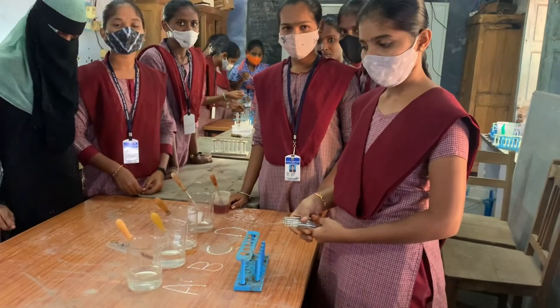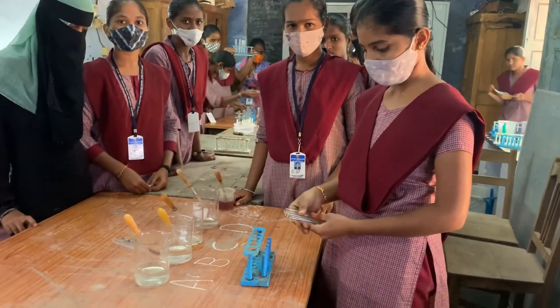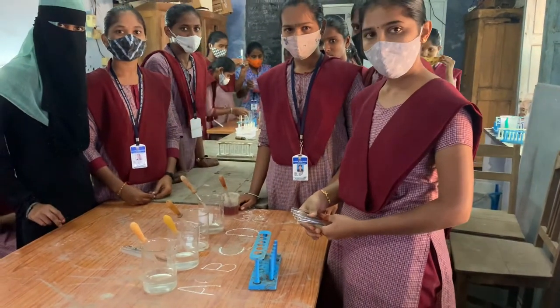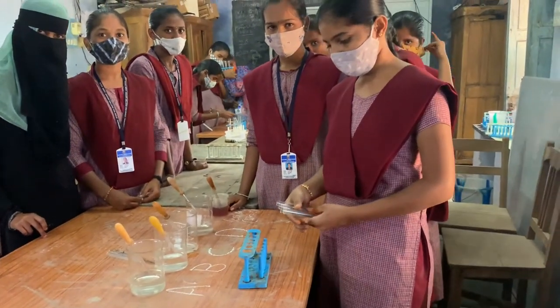We are going to perform the experiment on how to identify starch, starting with a given ABCD sample.